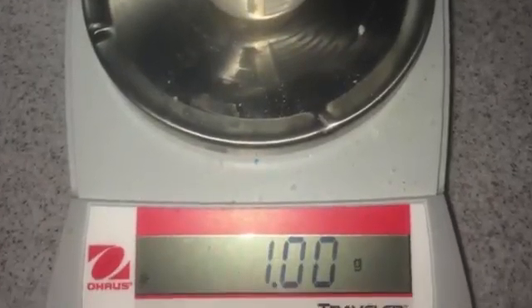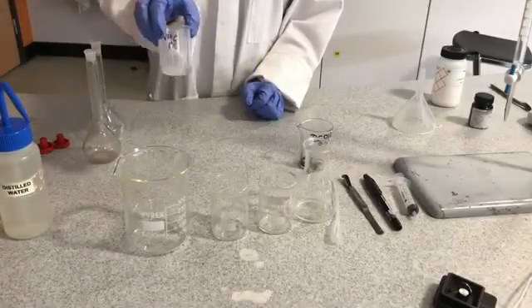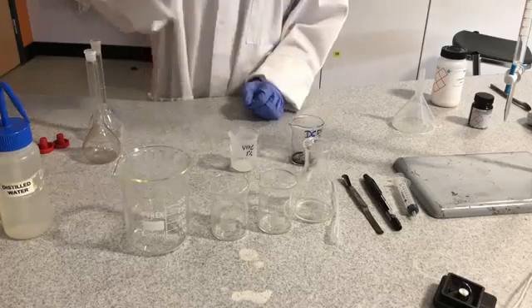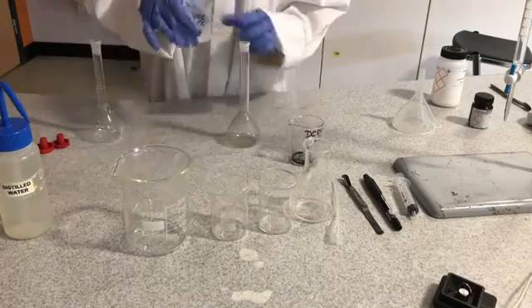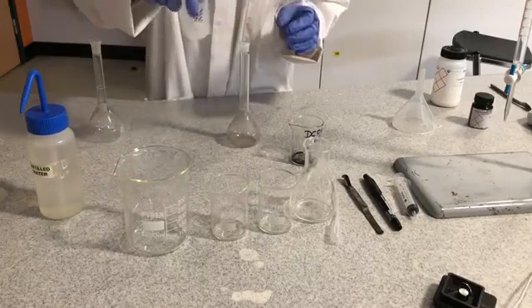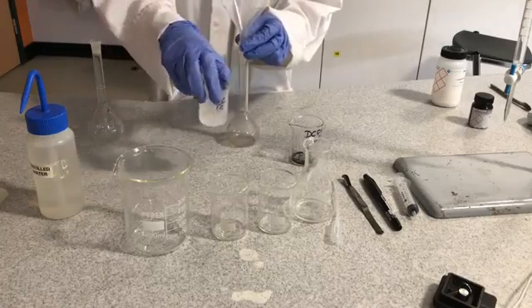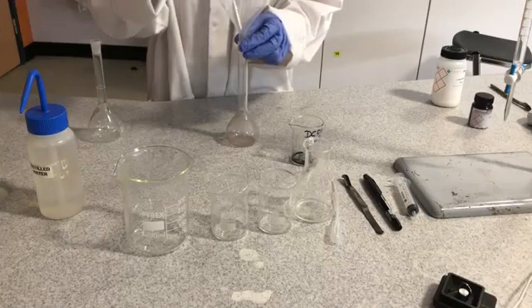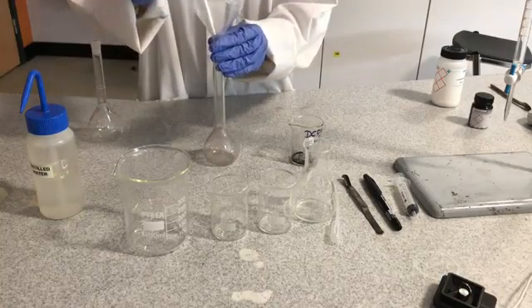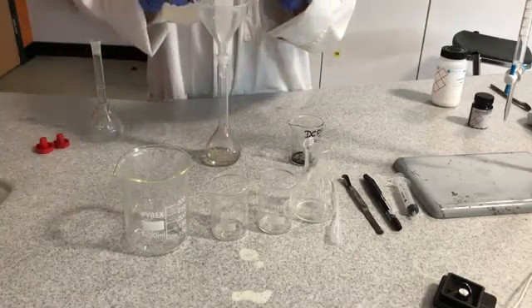Weigh out 1 gram of L-ascorbic acid and 0.1 grams of DC-PIP. Add 100ml of distilled water to the 1 gram of L-ascorbic acid. Pour the solution into a volumetric flask and make up to the mark.